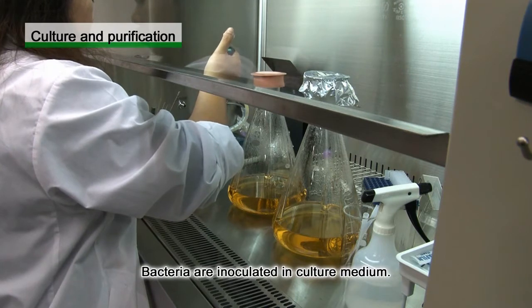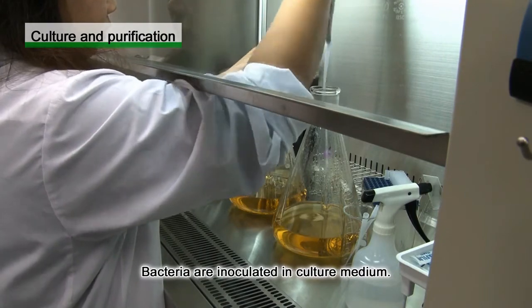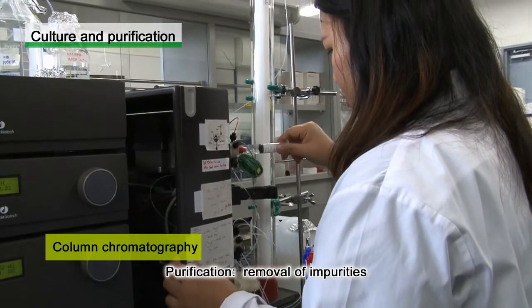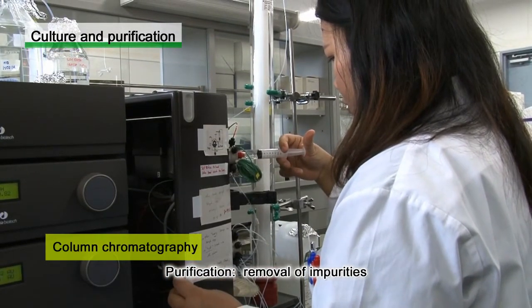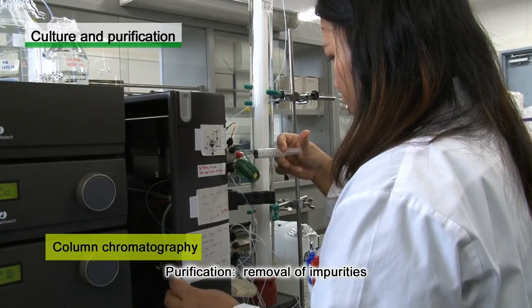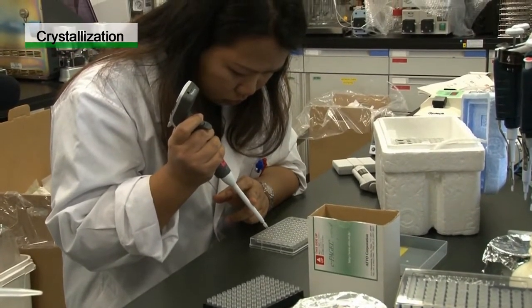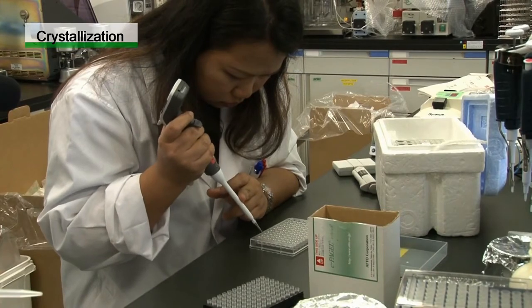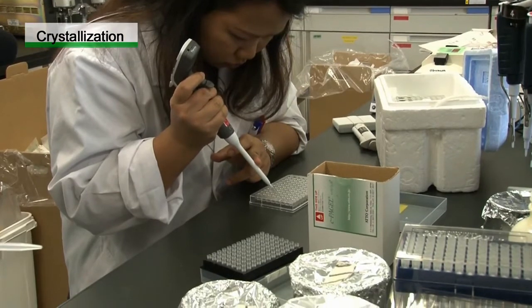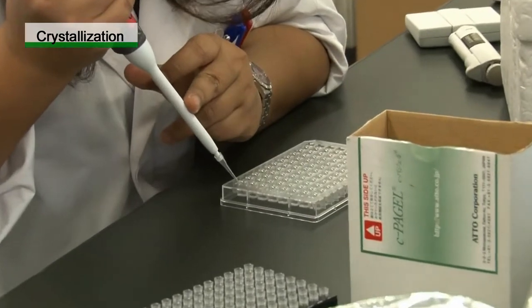Firstly, bacteria or other types of host cells that are genetically modified to produce the target proteins are inoculated in a suitable medium. Next, the target protein extracted from the bacteria or cultured cells is purified by column chromatography. After purification, a precipitant is added to the protein solution to crystallize the protein. Because the crystallization conditions vary depending on the type of protein, a number of trials are needed to find suitable conditions.